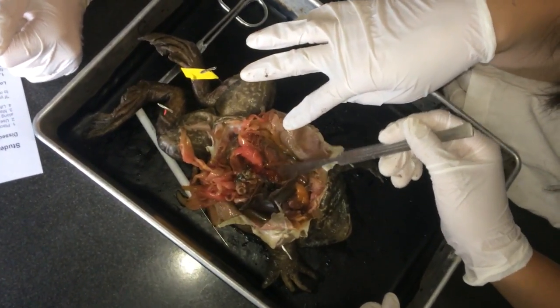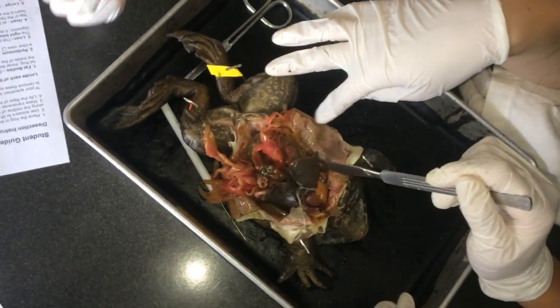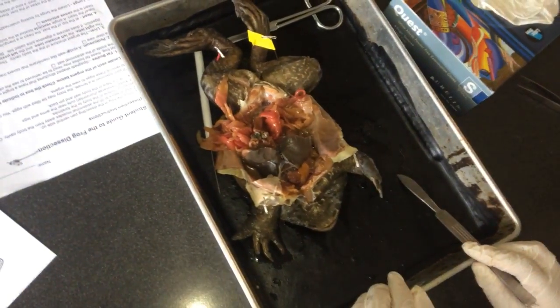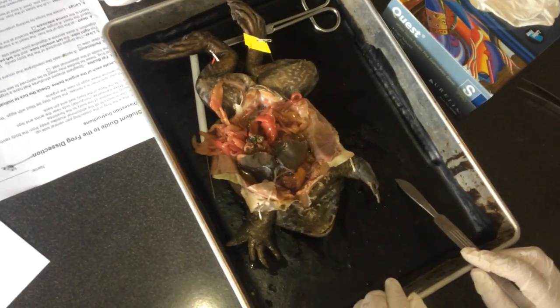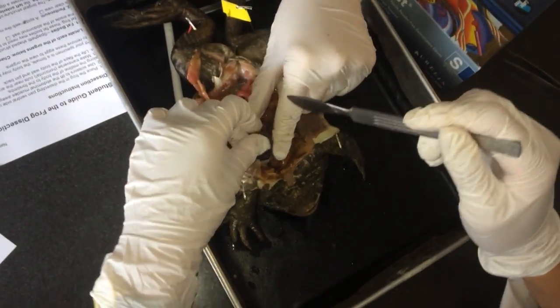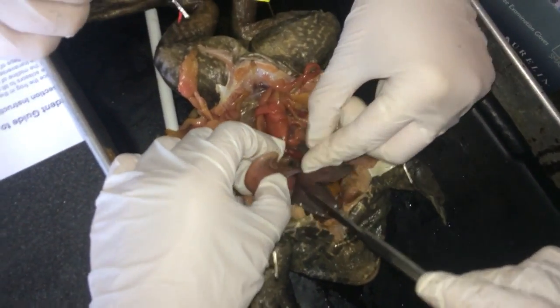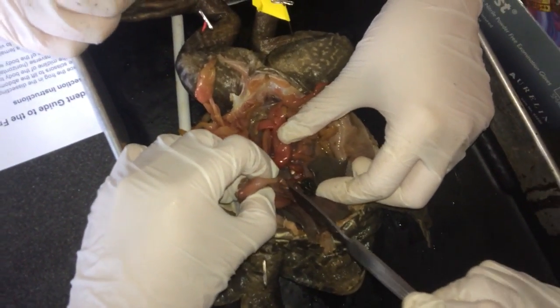Flattened, bean-shaped organs located at the lower back of the frog. Yeah, and spine. So we should ask... removal of the stomach — cut the stomach out of the frog and open it up. Hmm, interesting. Do I use scissors for that?